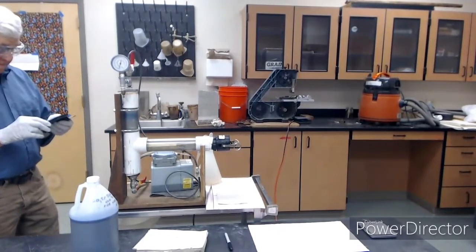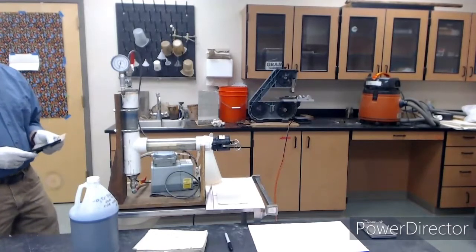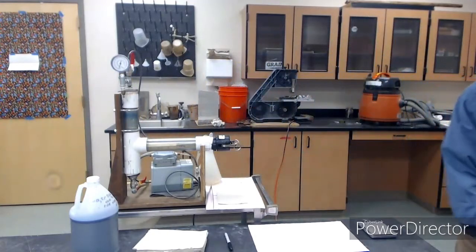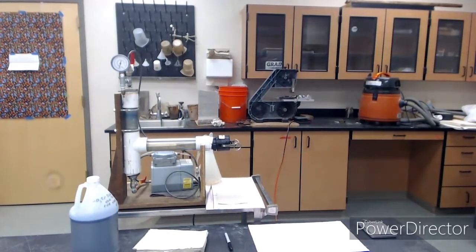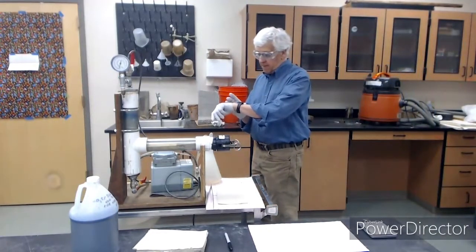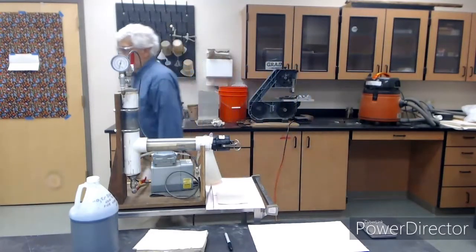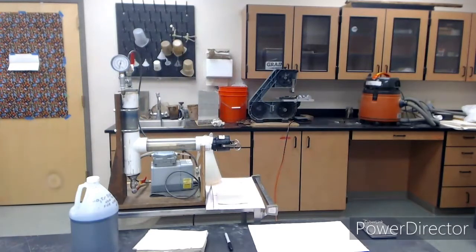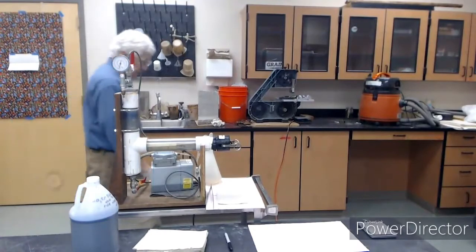That looks like 19 inches of mercury. So you can convert that to whatever you like in terms of bar or torr or Pascal or whatever. Oh, and I forgot to start the timer. So it's going to be approximately 5 minutes. You've got the video, so you can figure out the exact time, assuming that the video is real time. And now we just wait for 5 minutes. I'll see you then.